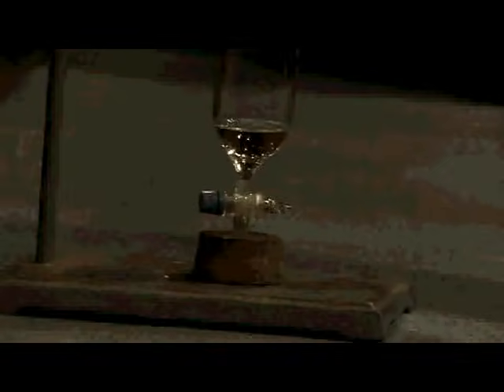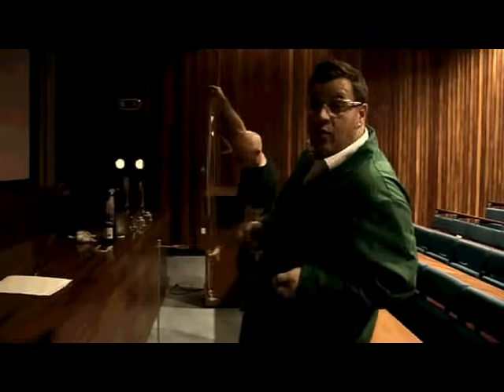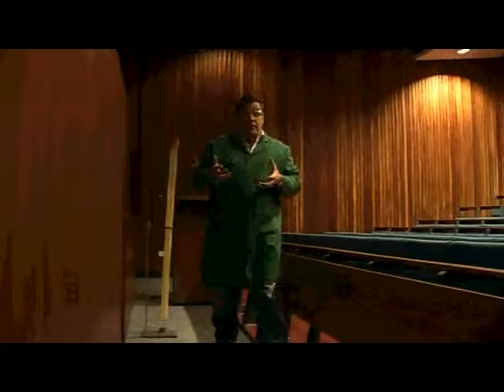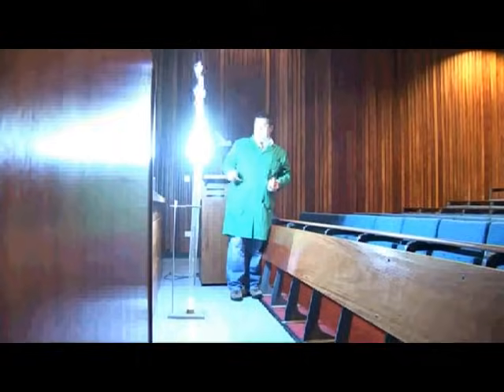So we've managed to create a darker environment so we can really see the benefits from this chemistry. Neil's put some water in the bottom of the tube, and we're going to put about six to eight millilitres of carbon disulfide into this tube - a good mix to ensure that we get all of that carbon disulfide going into the vapour phase, so it'll react really quite quickly with the oxidant, N2O. As the flame goes down the tube it accelerates because the reaction is going faster and faster, giving this great sort of whoop noise. That was a really, really energetic reaction, because the organic and the oxidant are all in the same phase.